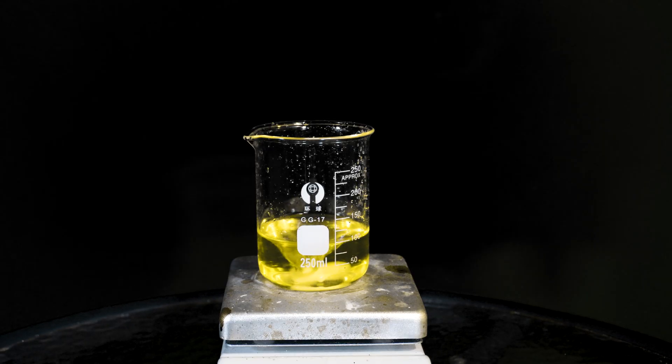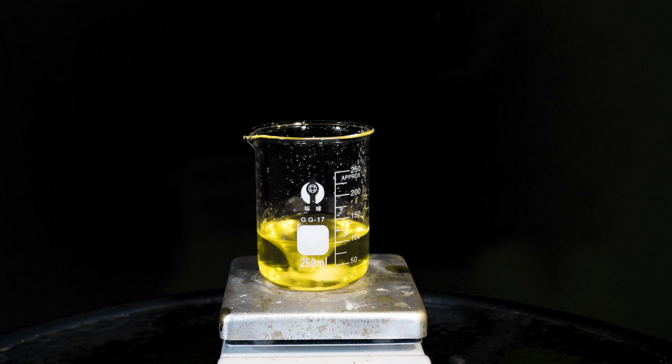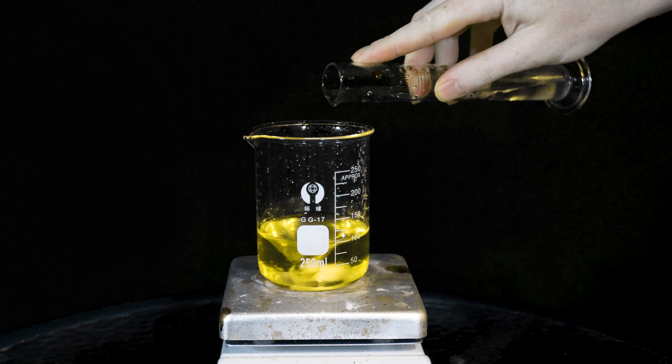Now we'll add about 10 mils of 34% hydrogen peroxide and get ready for the show. Some iodine will be released in this step.